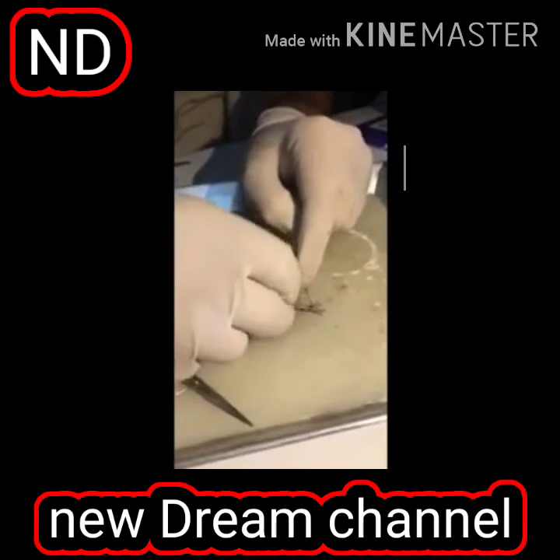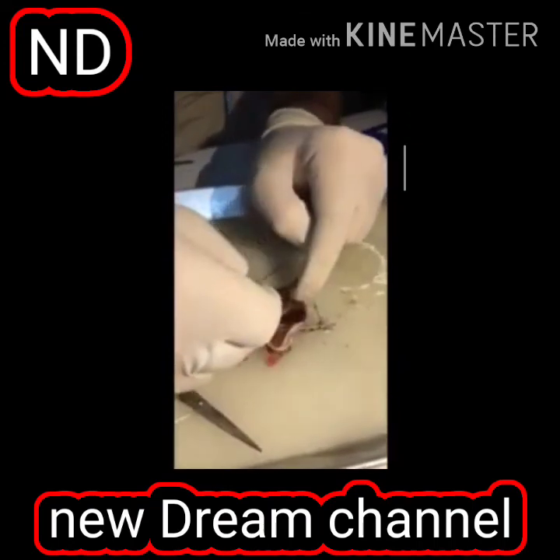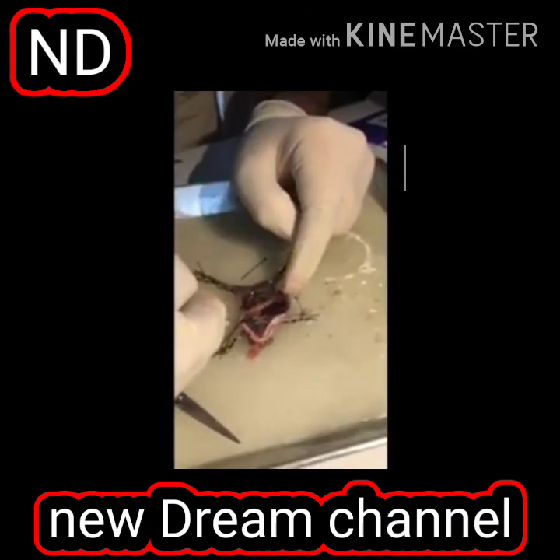If we see it properly, the esophagus here will come down like this, and then it will lead to the stomach, and it will complete the digestive system.